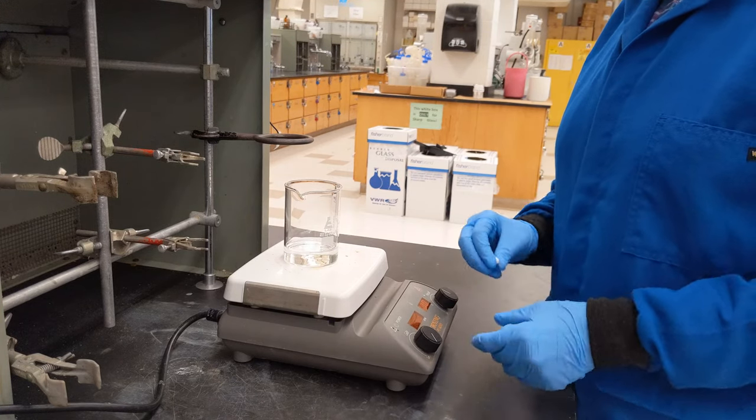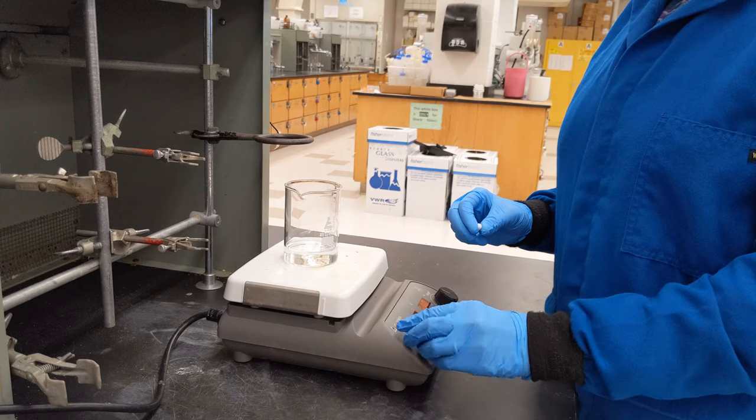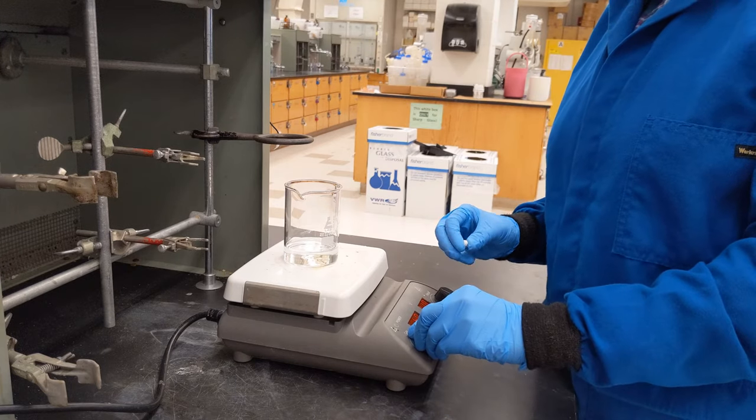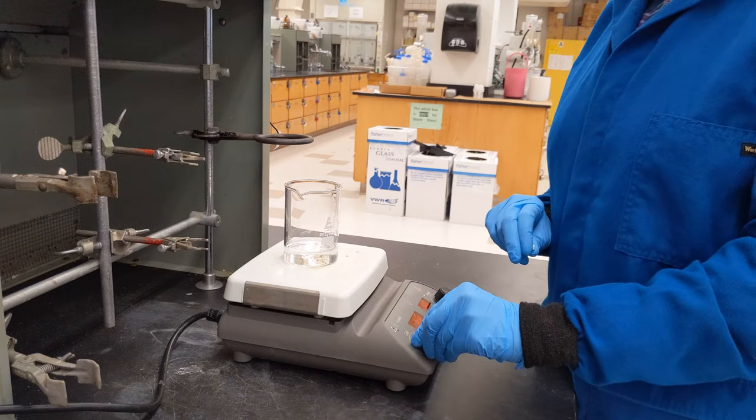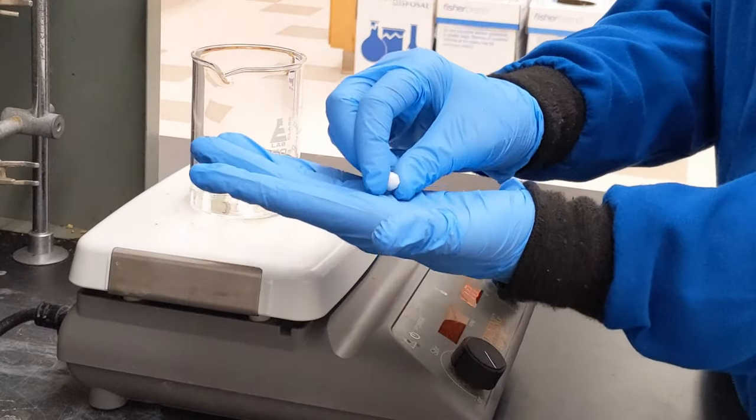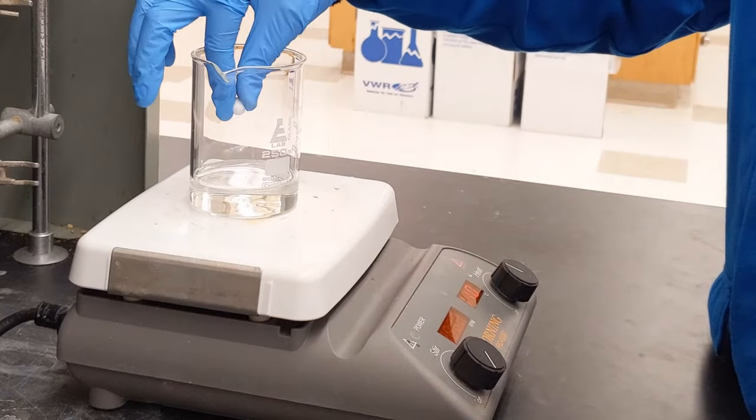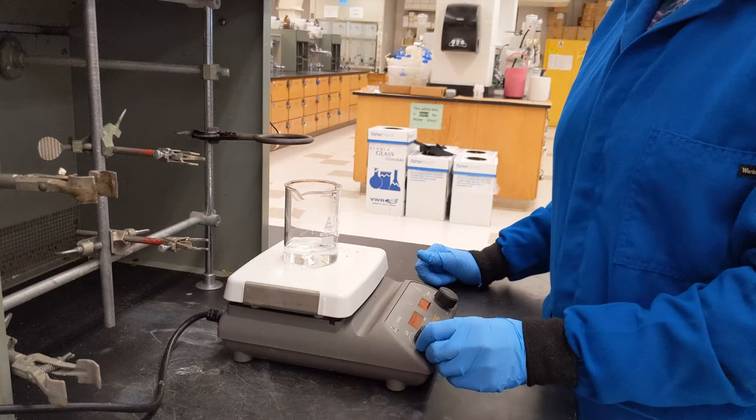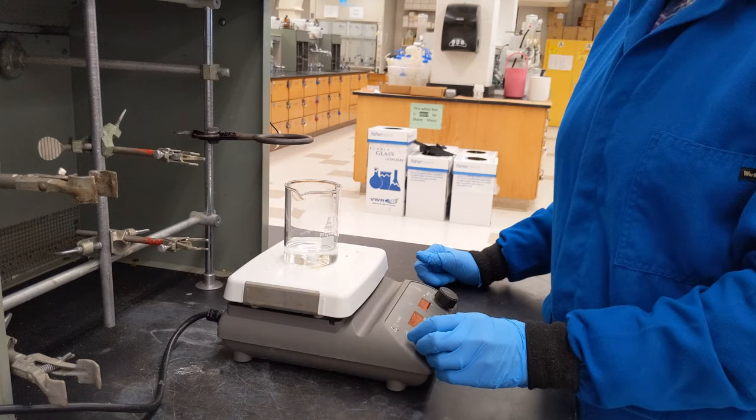This also has a stir function. If the only thing I do is turn on stir, nothing happens. I need a magnet. This is a magnetic stir bar. I want to put this inside of my sample and then turn on the stir function.